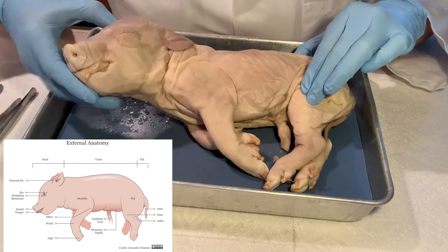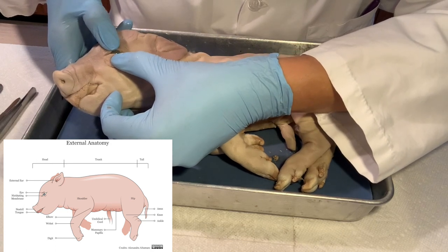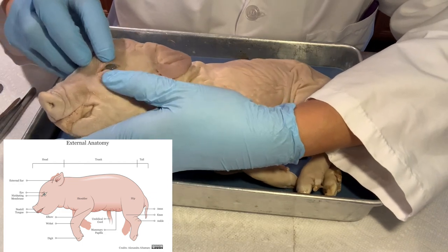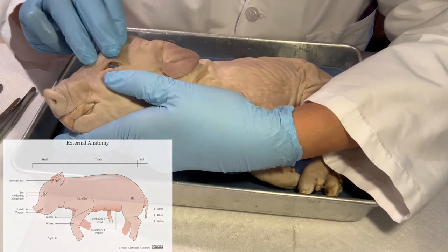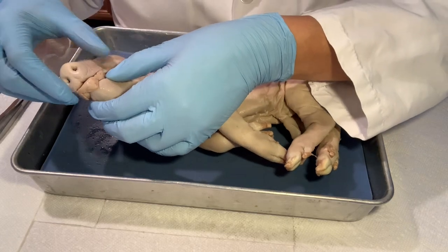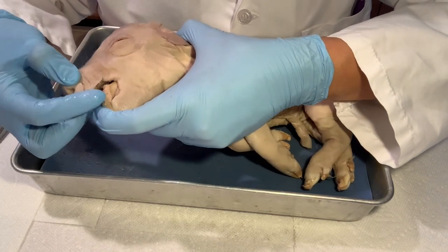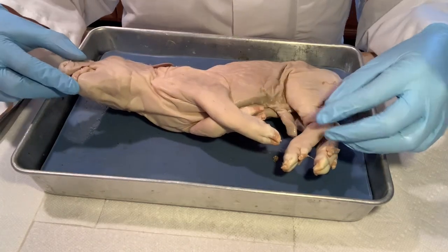If we open the eye, we see it's very hard to open — there is a membrane on the eyes. You don't get directly to the eye; there's a nictitating membrane that is very reduced in humans. They also have little eyelashes. If we check out the mouth, we have to be careful because they already have little teeth — some small, pretty sharp teeth. These pigs are born with teeth.